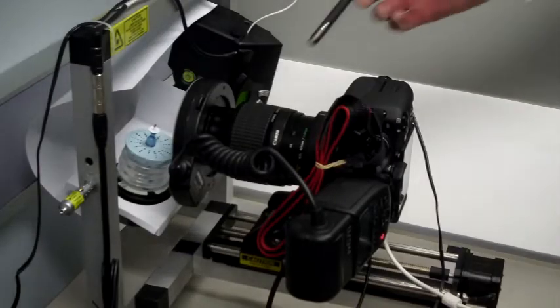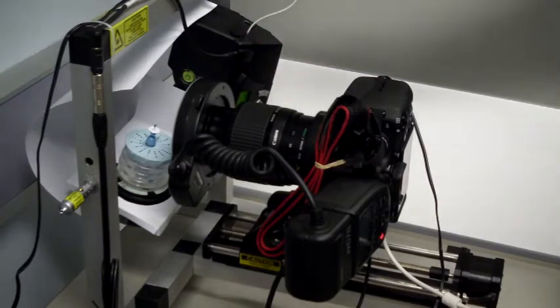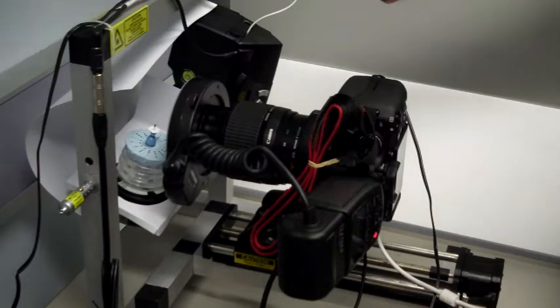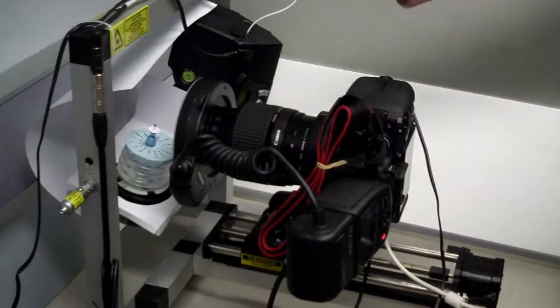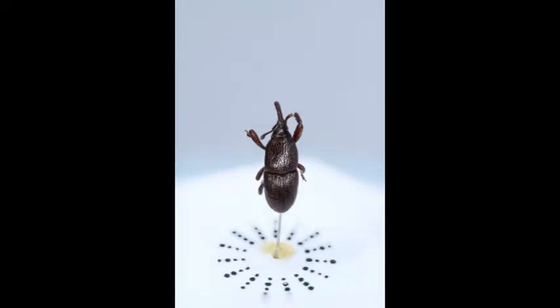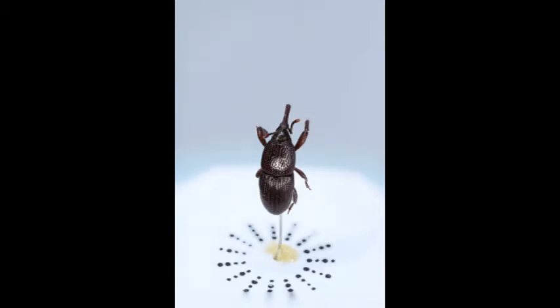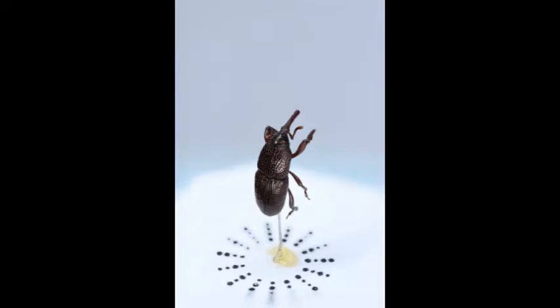The camera moves and captures images at different distances from the specimen. The camera captures images at different depth of focus. Then the images are combined into a single in-focus image. For a good result, the system will take around 4,500 images and then combine them into 144 images before a 3D model can be reconstructed.